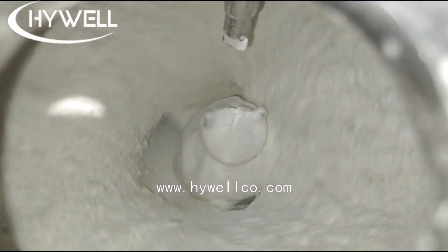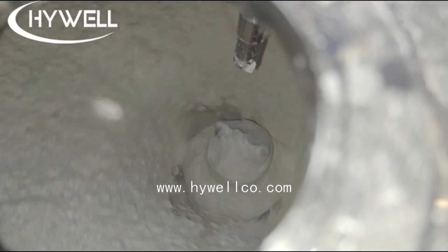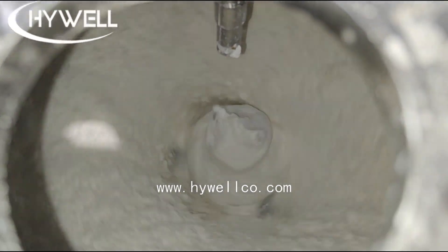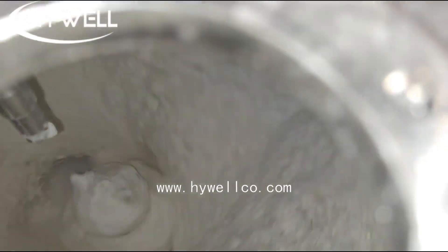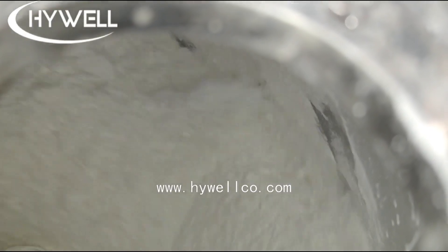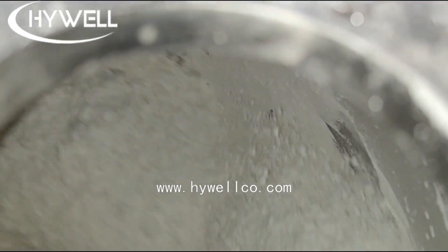Third, the wet powder material is squeezed by the swing roller in the swing granulator and passes through the screen to form wet powder particles. The size of the particles is determined by the sieve. Fourth, the wet particles are transported to the static fluidized bed dryer by a belt conveyor.